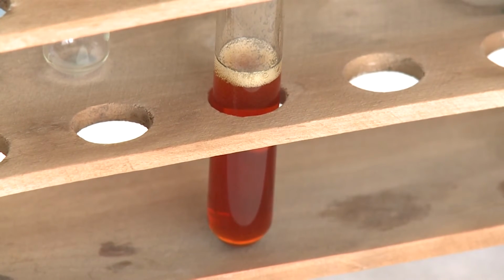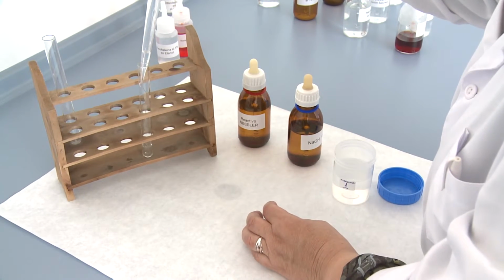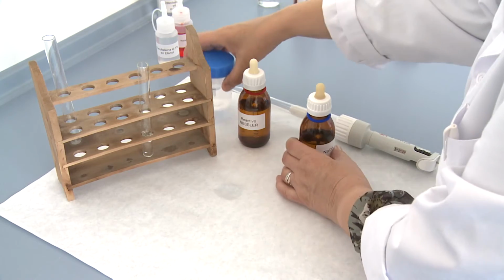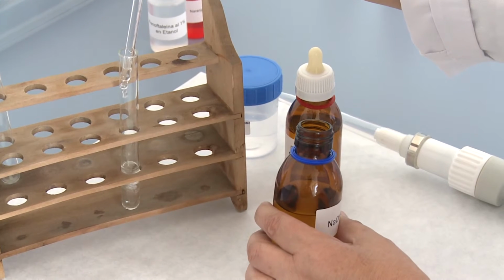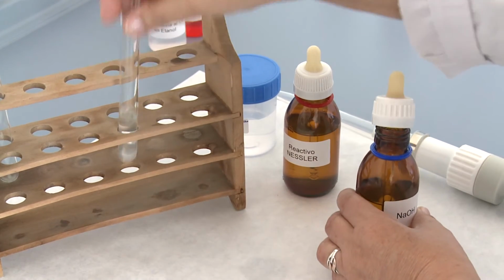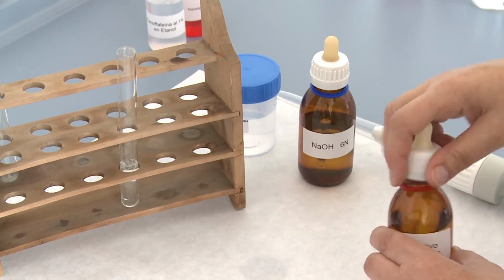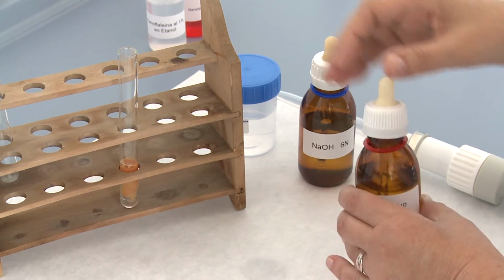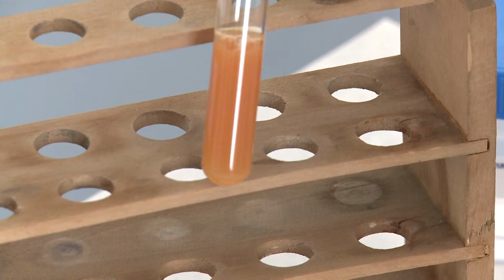Research of ammonium. In a very clean test tube to avoid interference, add a few milliliters of the water to be analyzed. Add 4 or 5 drops of hydroxide solution. And then about 3 or 4 drops of the Nessler reagent. A precipitate will appear, and depending on the color, it will indicate a higher or lower presence of ammonium.